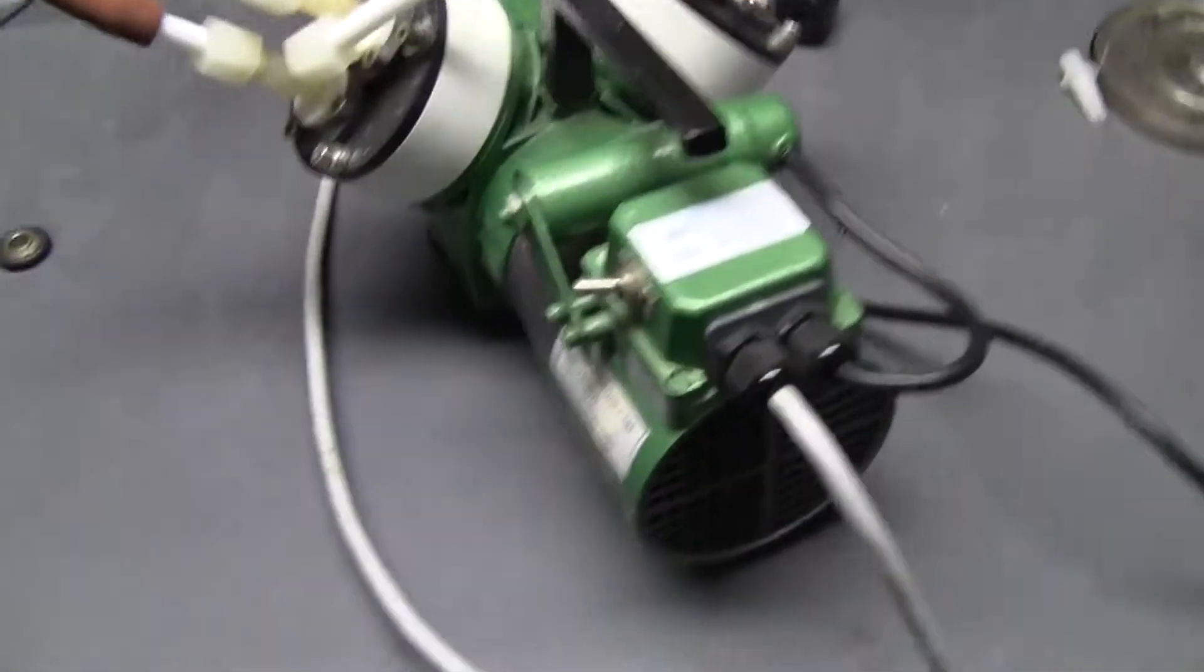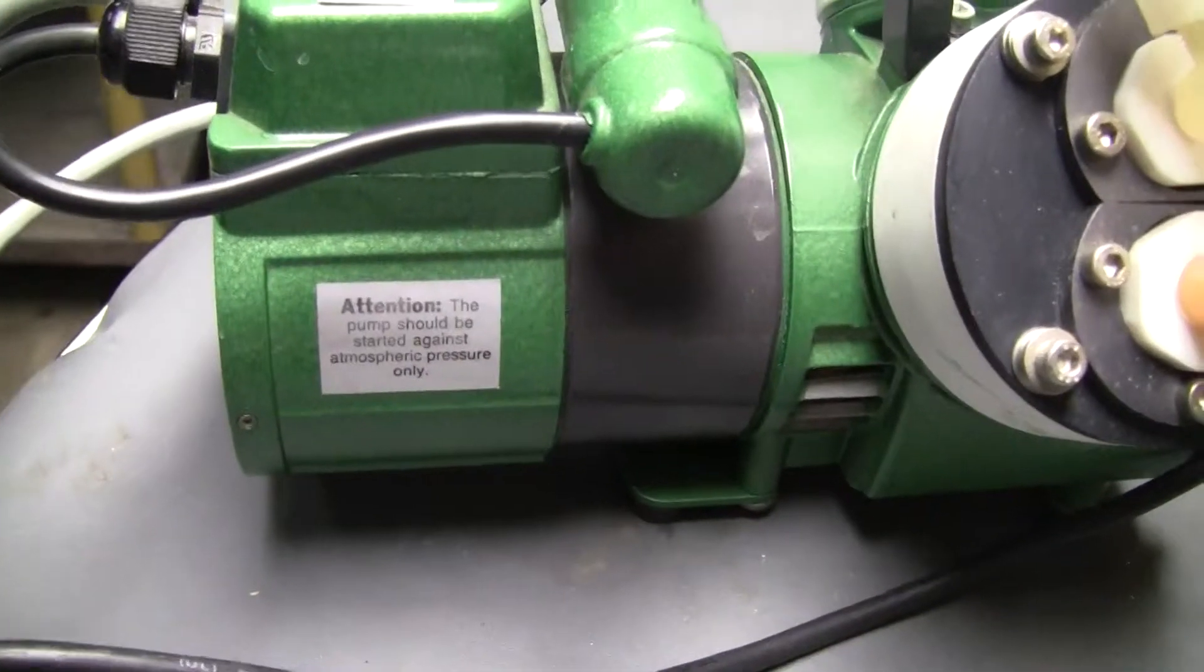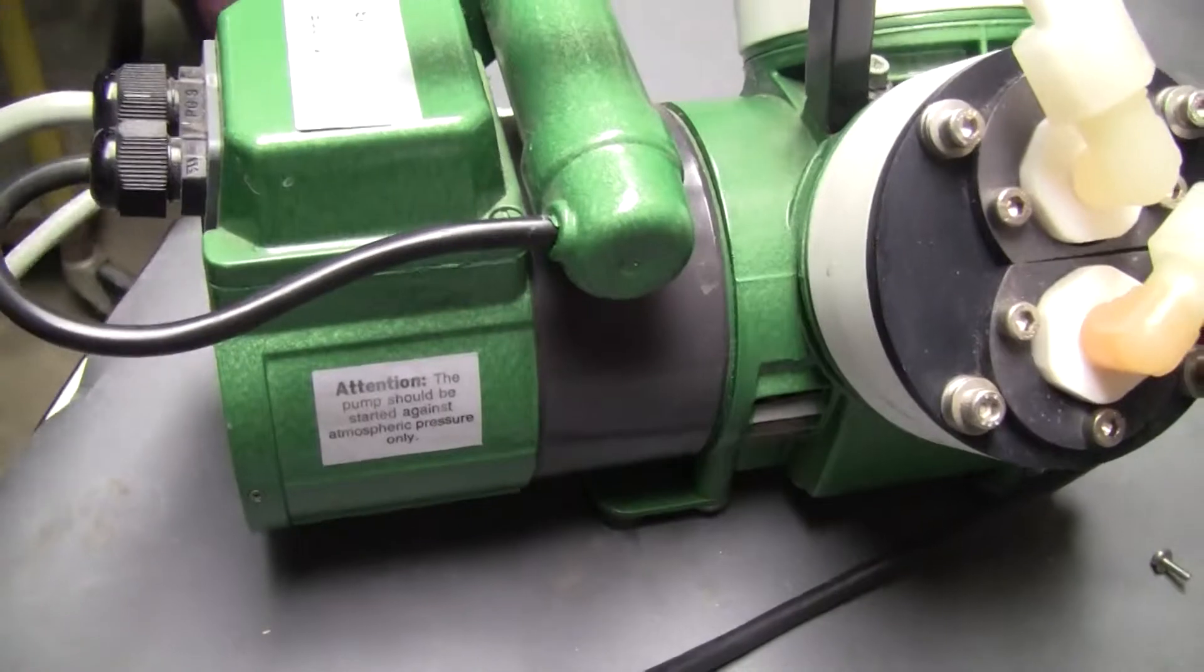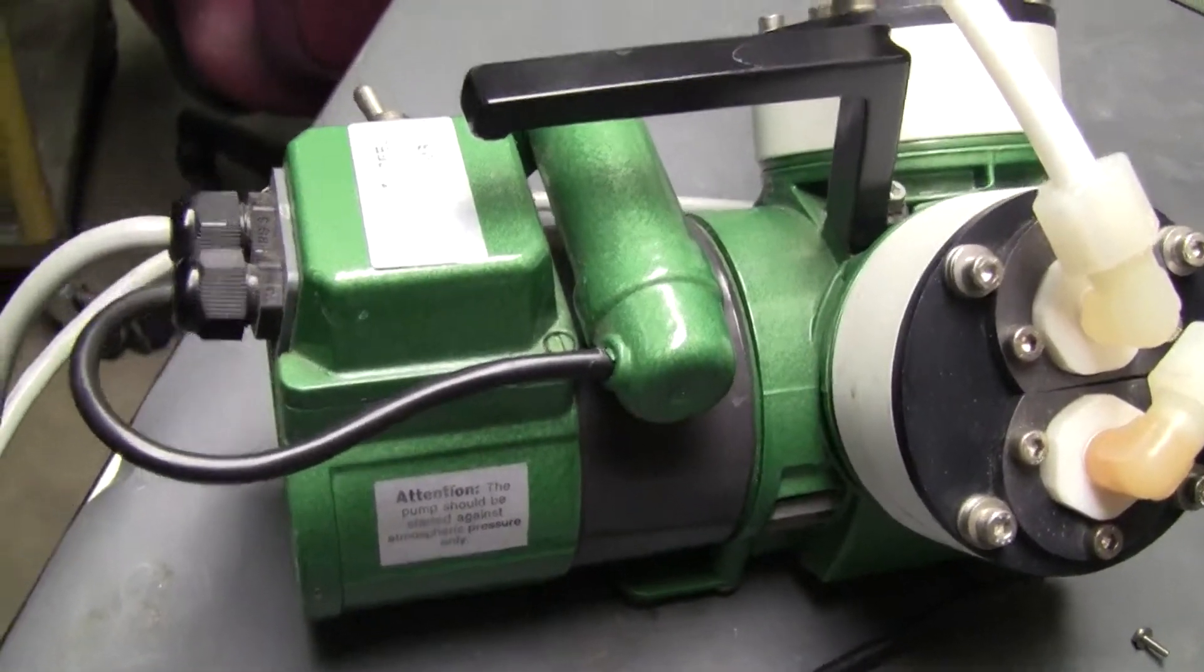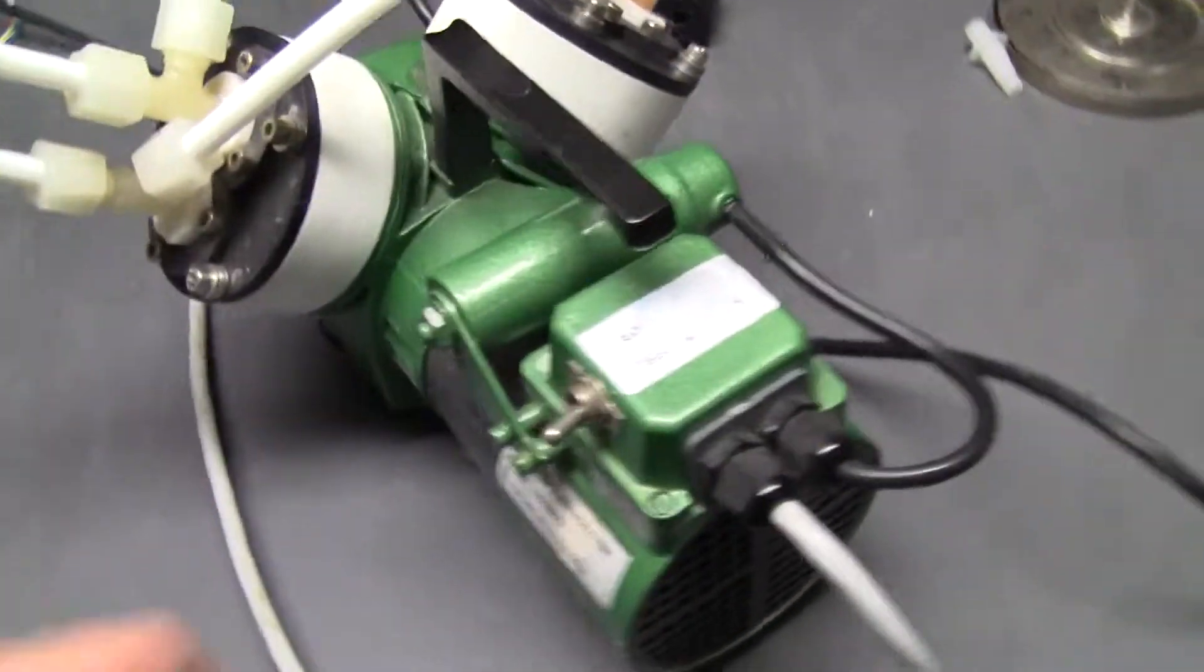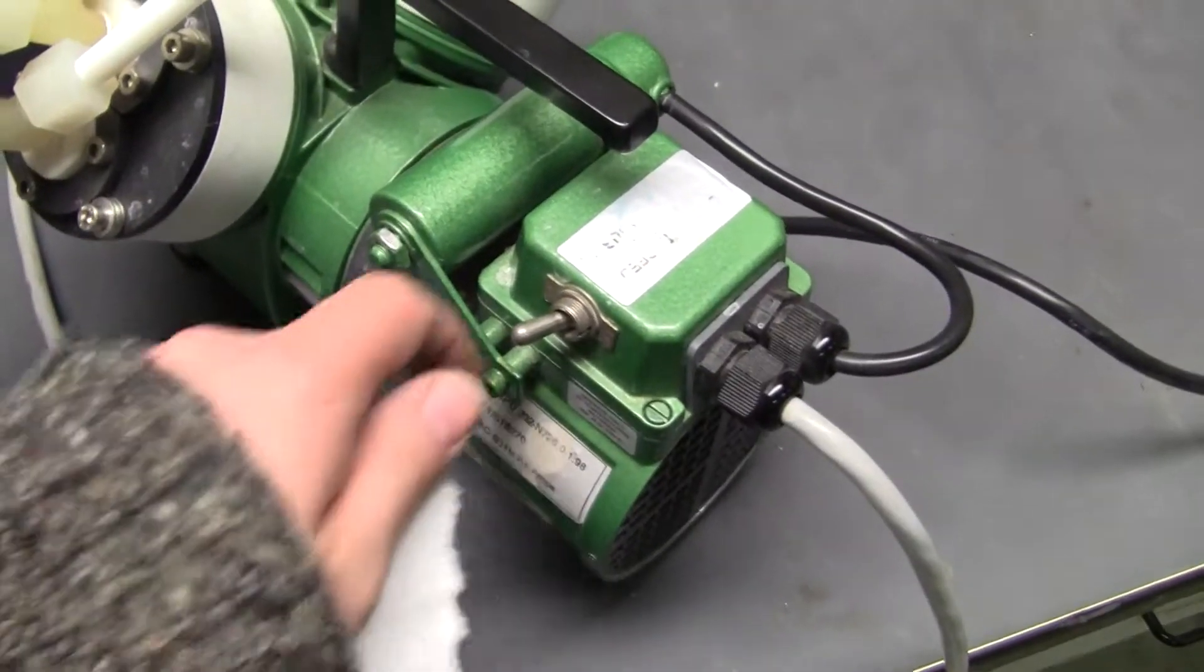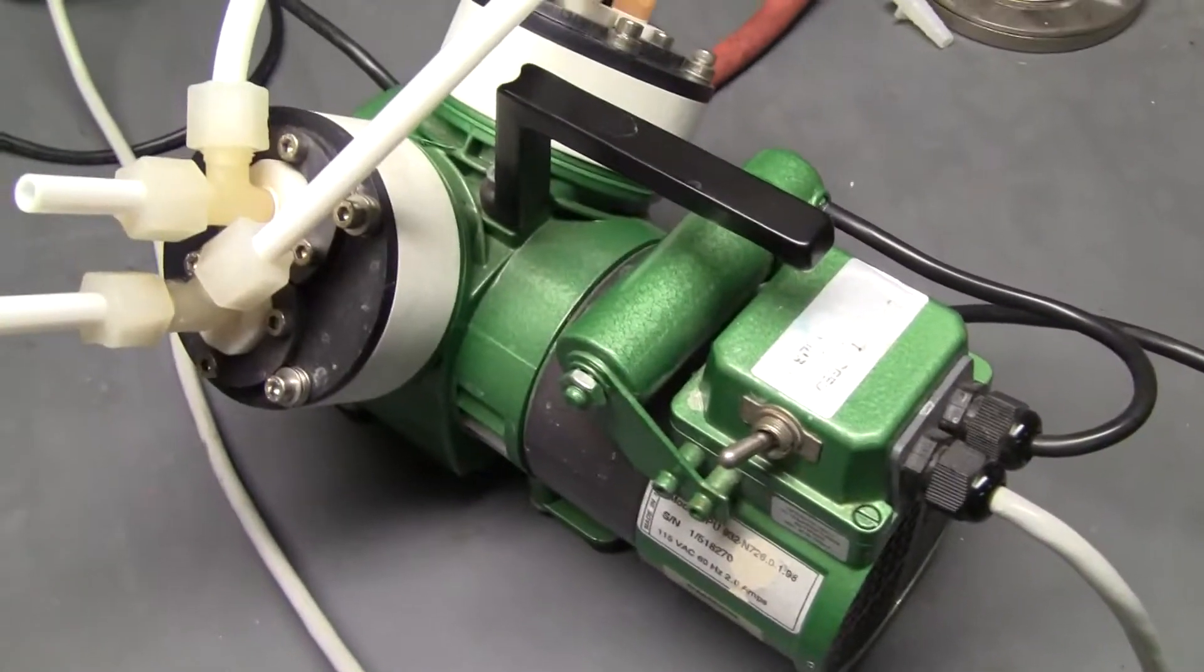Something to note. There's a sign right on the side. It says that when you shut off the pump, you need to expose the vacuum line to atmospheric air again to restart it, or that happens. But by exposing it to atmosphere again, it'll start right up.